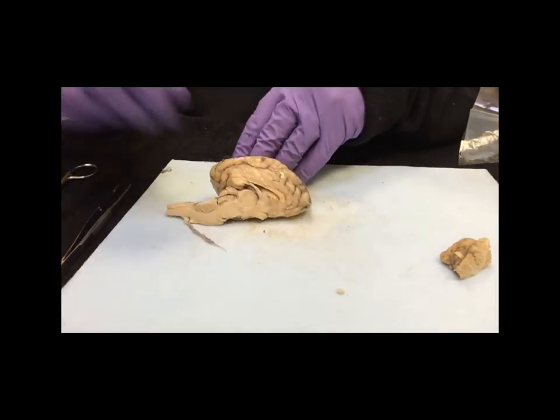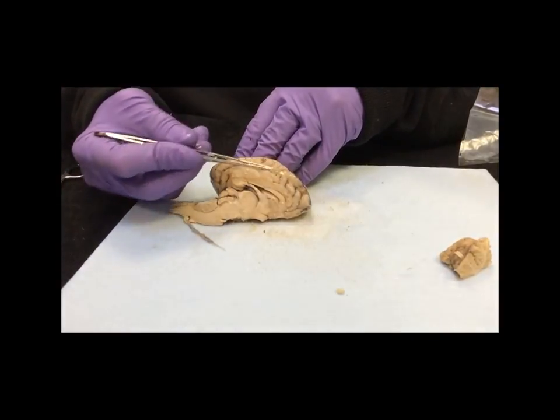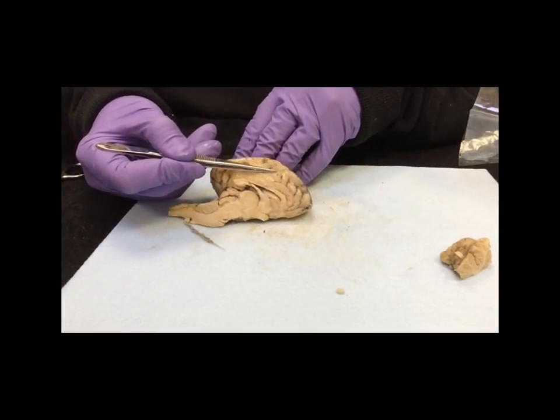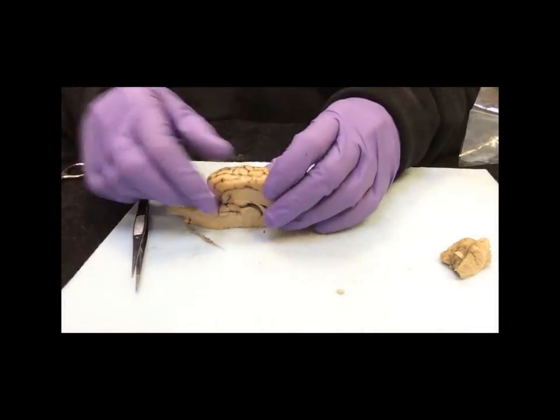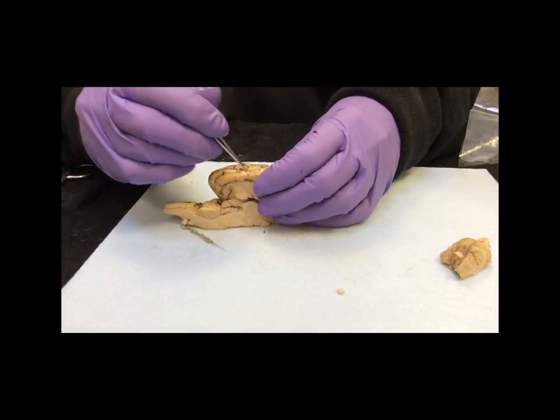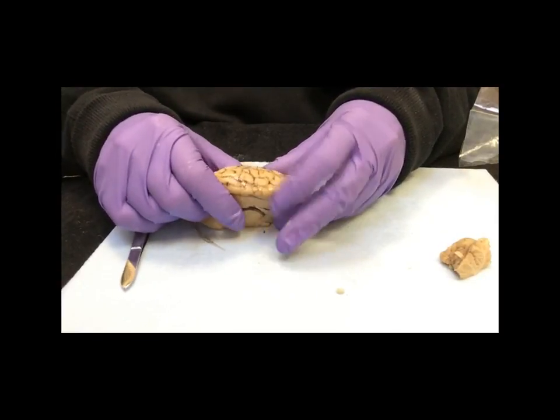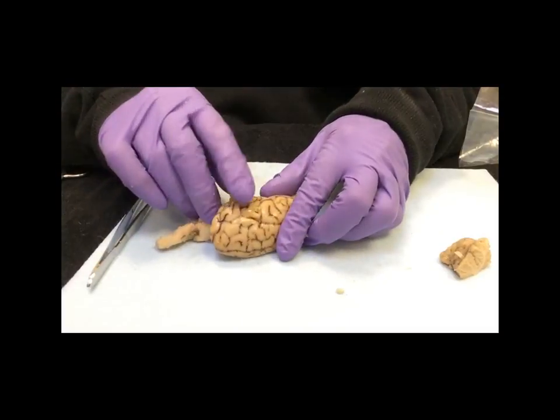I just want to note here, similar to the cerebrum, that when you did that sagittal section, you weren't really cutting this. You weren't cutting anything until you got to the corpus callosum. This again was just a fissure, and it's just a fold, and if you were to gently pull this apart, you would see that these were all little fissures and sulci that increase the surface area. The pia mater is holding it all together right now, but these structures are actually not joined. They're folds, as perhaps you can see right there.